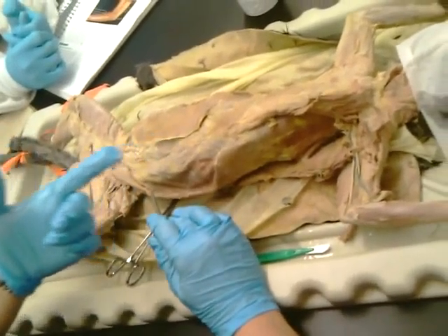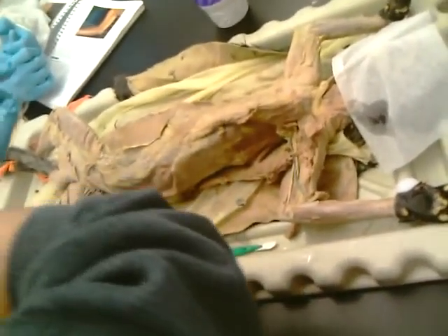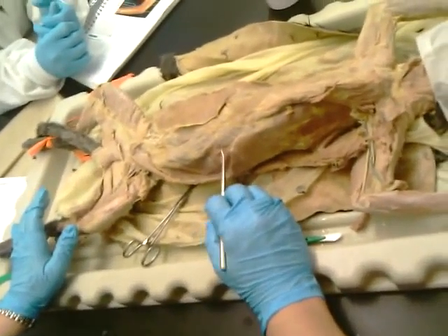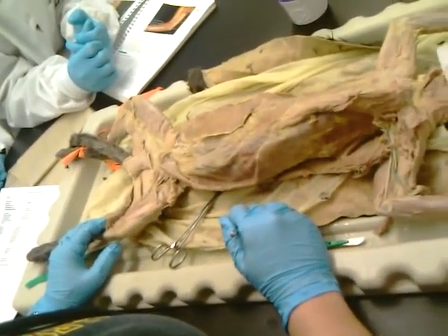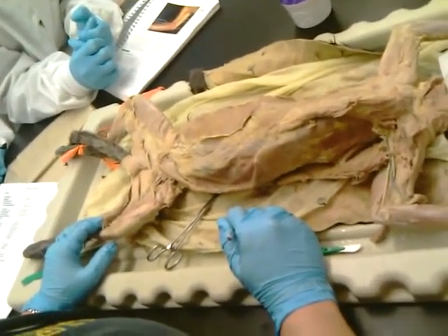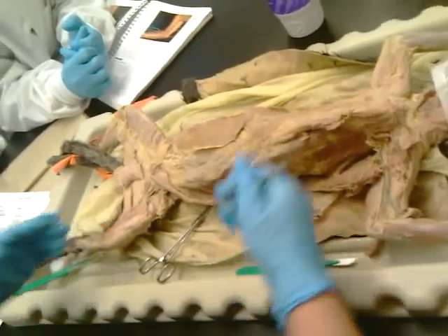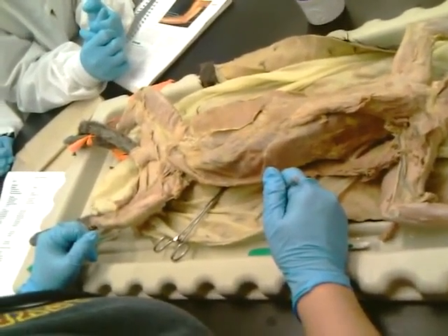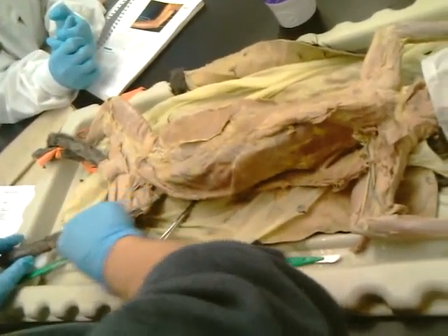When you're talking about bodybuilders, you can really see the saphenous veins and the superficial veins. The saphenous vein is also what they harvest for heart bypass surgeries. Why do veins pop out when you're stronger and muscular? You have less body fat to hide them. Oh, okay. Yep. And they dehydrate themselves to make them more visible. Okay, so that's what we have here on the front and lower legs.